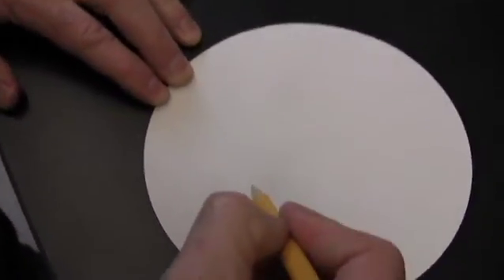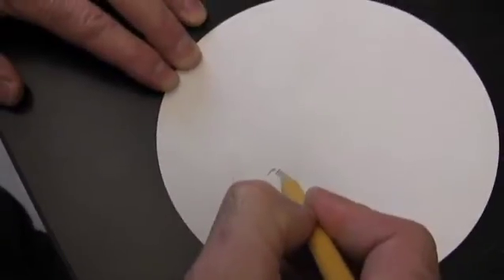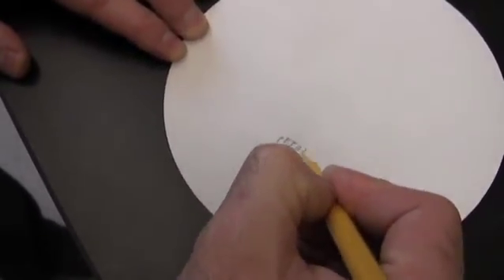At this point I also like to label it with the vector that I'm sending, and that way the collaborator knows that that spot corresponds to that plasmid.